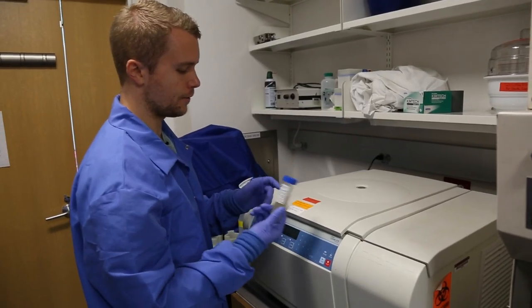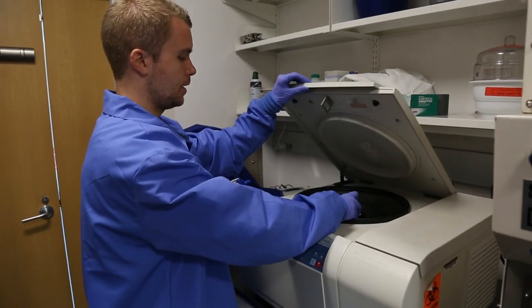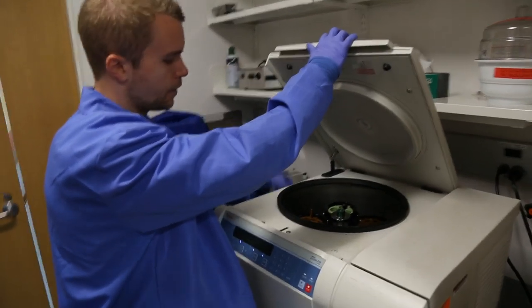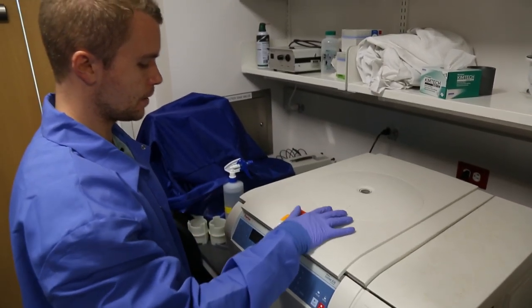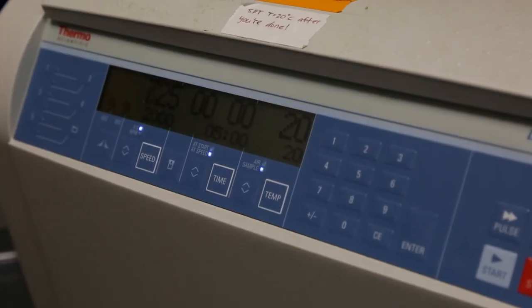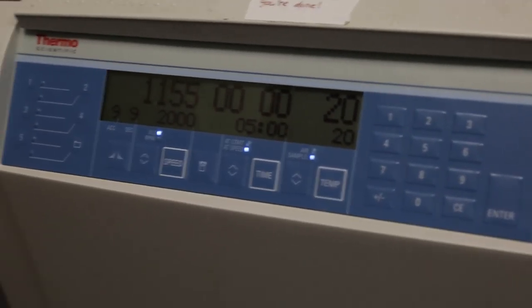Now that it's hydrated, all I have to do is place this in my centrifuge. I'm gonna balance this—I put in 35 mils of fluid, so I'm putting in 35 mils as a counterbalance. For this we're doing 2000G for five minutes, and we'll just come back when it's ready.